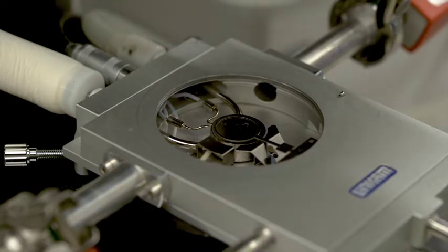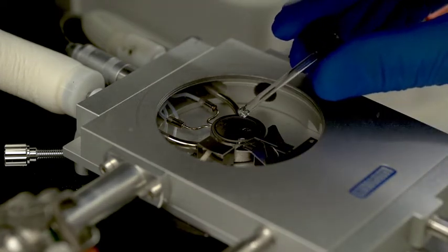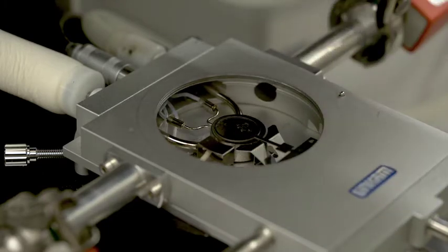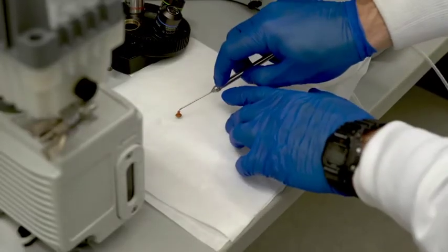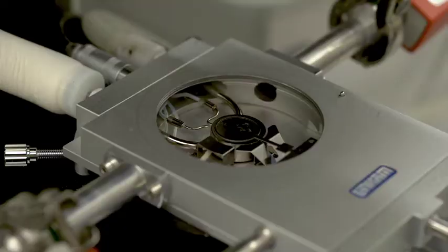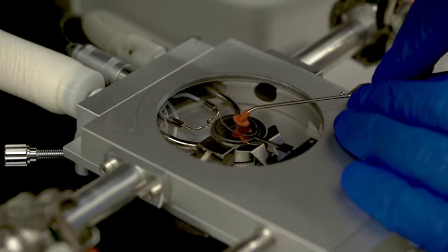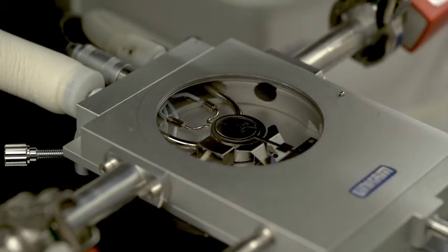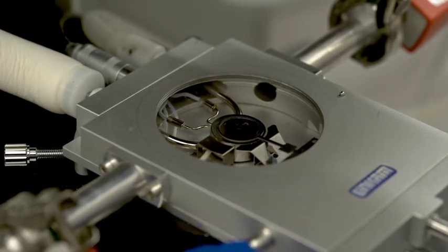Place a small volume of heat transfer oil on the temperature regulated stage. Be sure to place the drop slightly off center so as not to plug the illumination hole. Using the vacuum tweezers, place a large glass cover slip in the lollipop hoop. Move the stage around using the adjustment knobs to ensure the cover slip is seated and the oil is uniformly distributed.